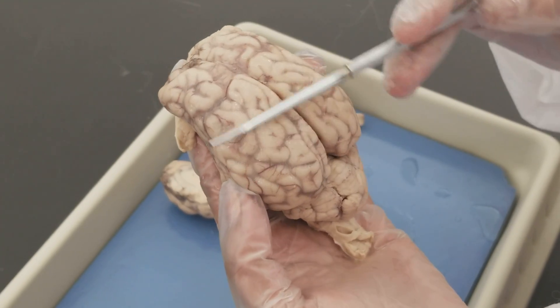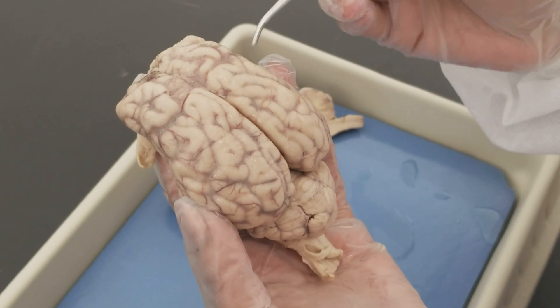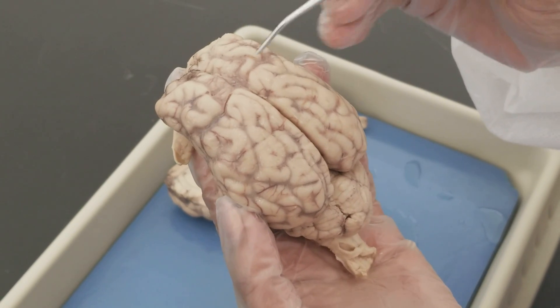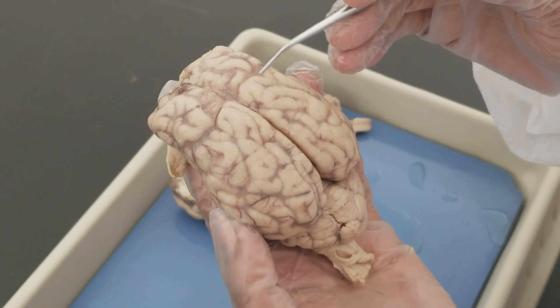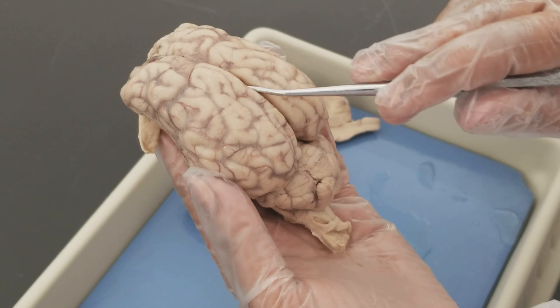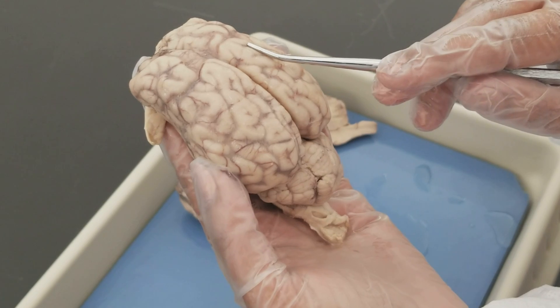The superior view of the brain shows you the cerebrum, and on its surface you see ridges which are elevations, and grooves which are shallow indentations. The ridges are called gyri and the shallow grooves are called sulci. The deep grooves are called fissures. You can see a longitudinal fissure here that separates the cerebrum into the left and right cerebral hemispheres.